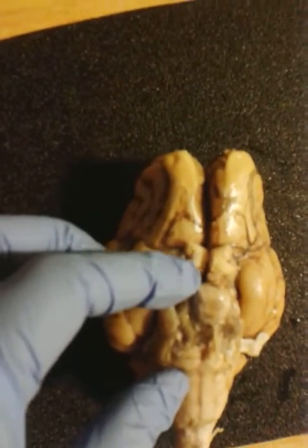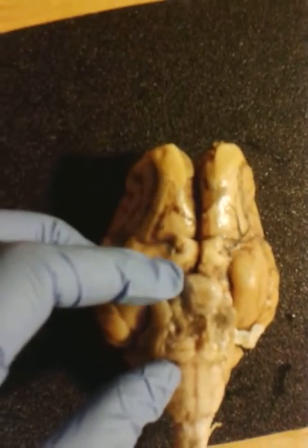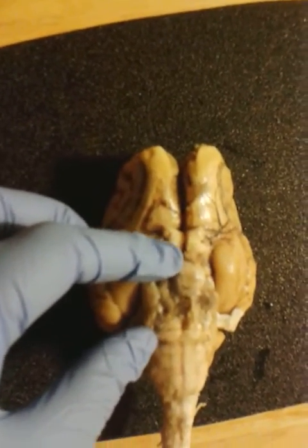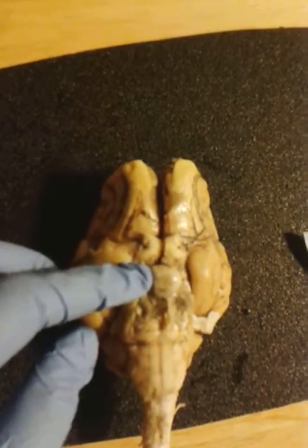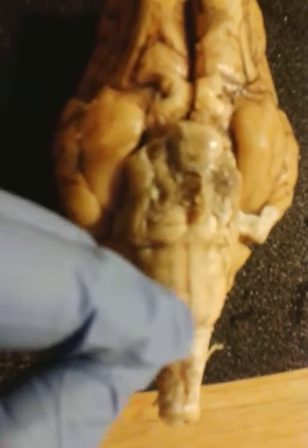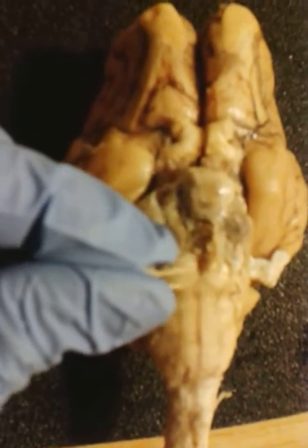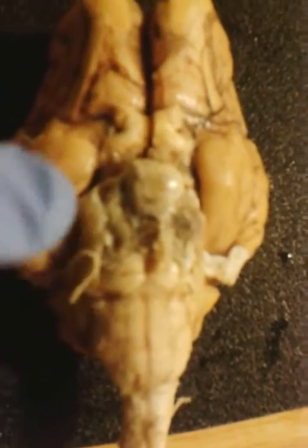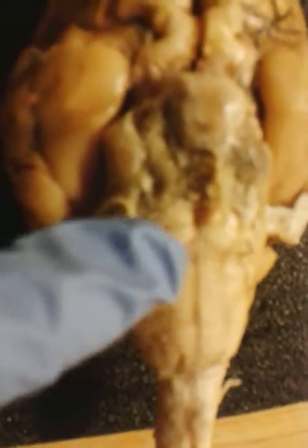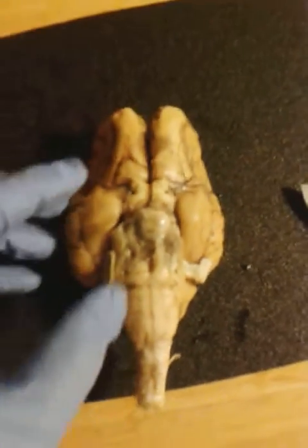The trochlear nerve would be passing right up from the cerebellum to this inferior portion of the brain. And then the abducens, I actually believe the abducens nerve was detached from the model, just by me being a little too rough with it. My apologies. But it ran right along here.